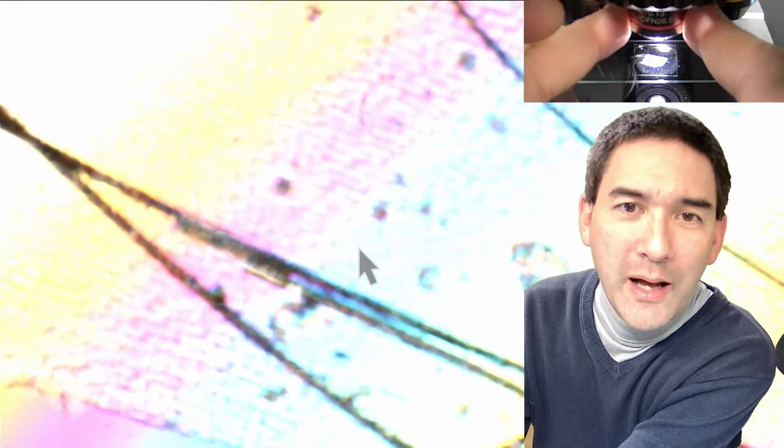And if you use different objectives, oh my gosh, I found out. Look, now I know why it's not parfocal. Do you see this? It's not screwed in properly. I have to screw it in. Why does this become loose? I hope I'm turning this in the correct direction. That's the reason: if it's not properly screwed in, then of course it's too much down.